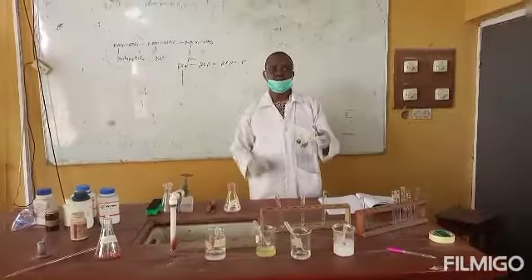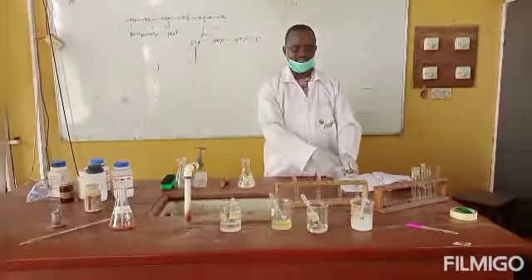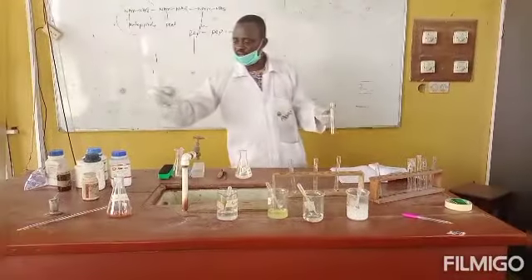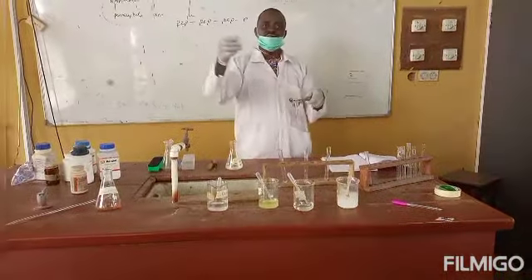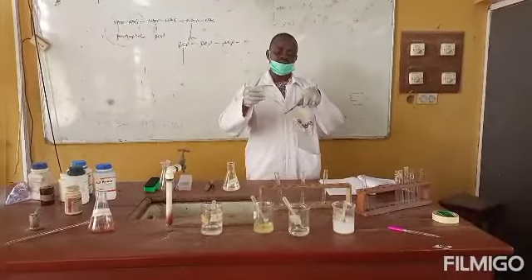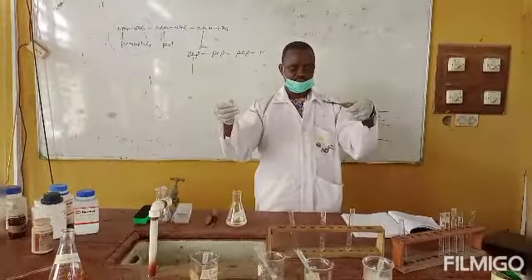So to demonstrate the reaction for each of these carbohydrates, 2 ml of each of the carbohydrates provided, starch, sucrose, maltose, and glucose, have been measured into the test tubes. I will now add 2 drops of alpha naphthol solution into it. While adding the 2 drops, you make sure that you dip the pipette into the test tube so that the drops will go straight into the solution. 1, 2. You mix.